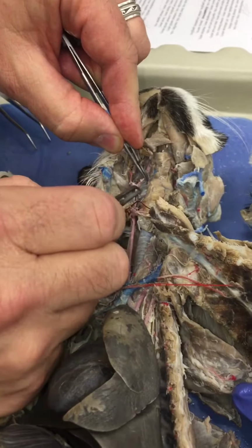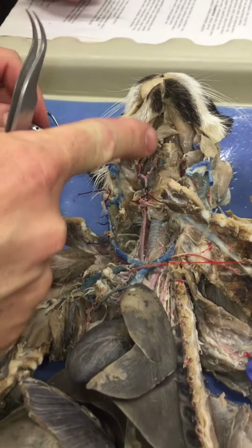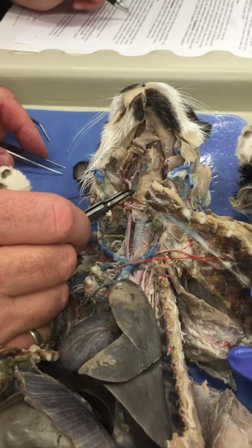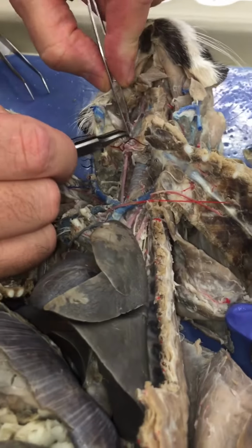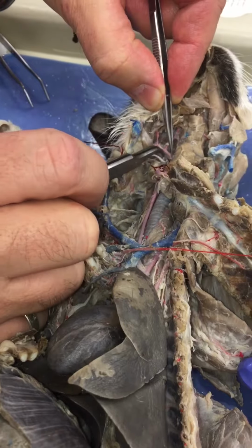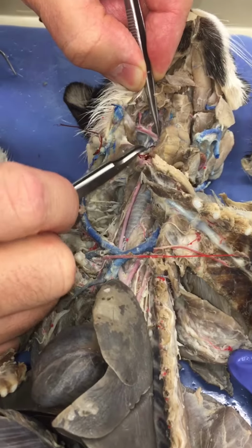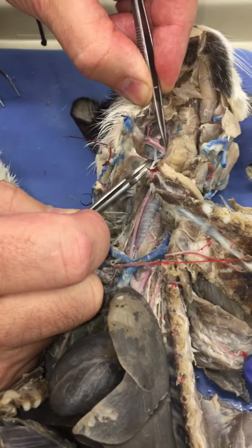looks like this is the ascending pharyngeal right here. It comes off at an angle going cranially, medially, and dorsally. So you can see this one, the angle that this one's coming up here. The occipital is the hardest to find because it goes straight dorsally to the skull. So if we look in here and try to find something and follow it back, there's a lot of other fascia in here. You can start to see part of it right there.